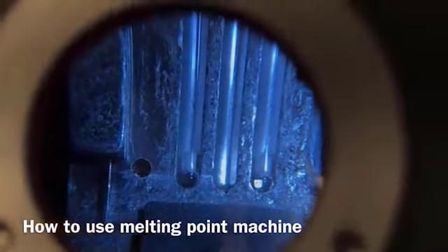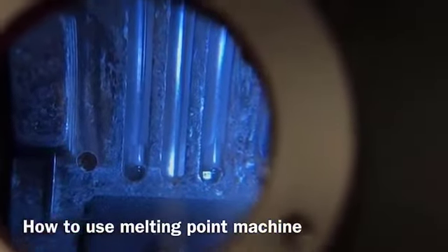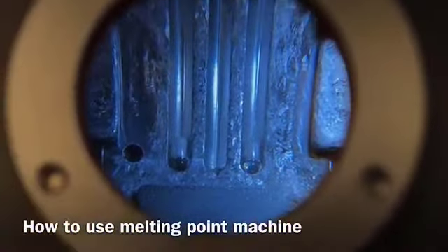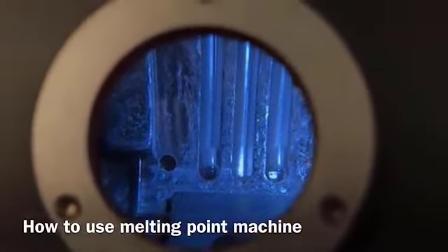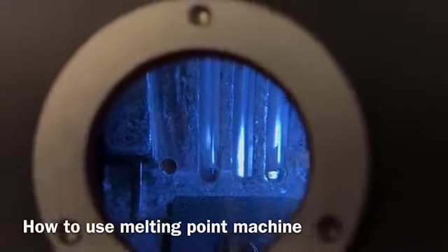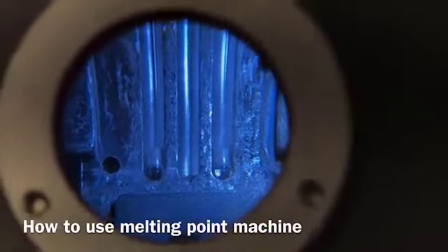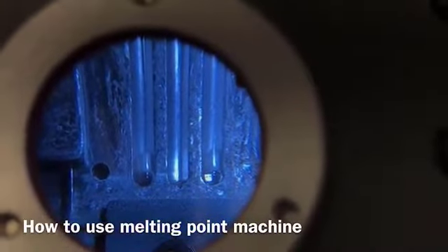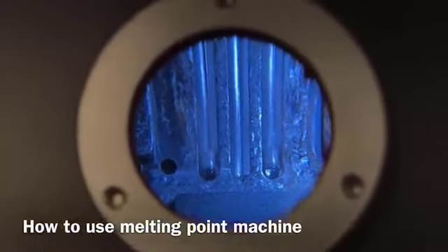For the pure sample, it should be a very sharp range, like between 1.5 to 2 degrees centigrade, not more than that. An impure sample has a broader range and also melts at a lower temperature than the pure sample. You need to keep all these things in mind when you record the melting point.